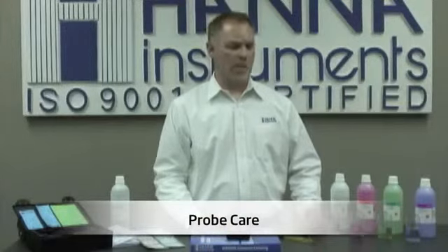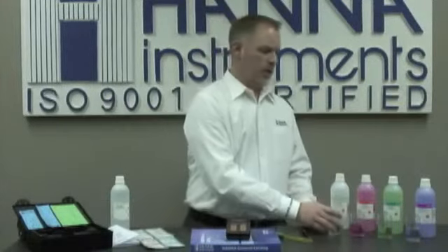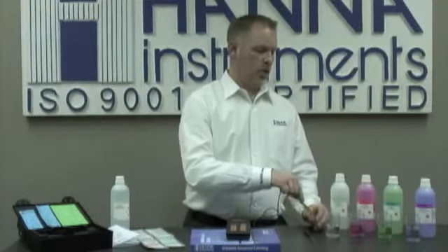Now that we've completed our measurement, it's time to put the probe away. We need to use some of our storage solution in the protective cap to maintain the condition of the probe. If you don't have storage solution, you can use any one of our buffers.